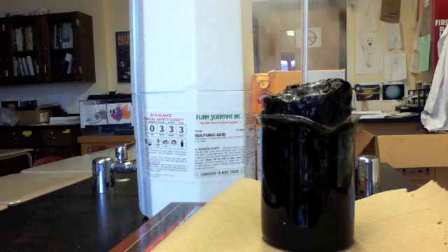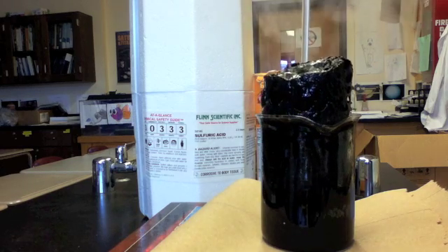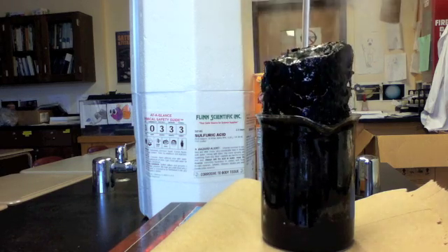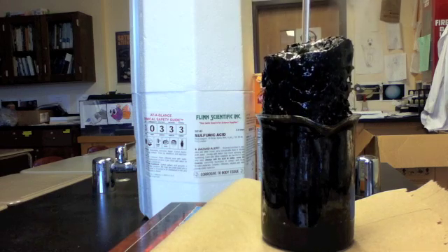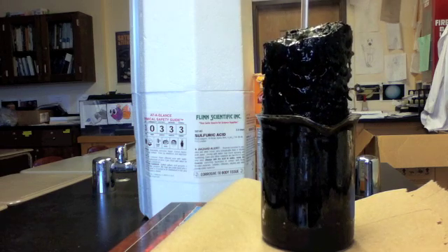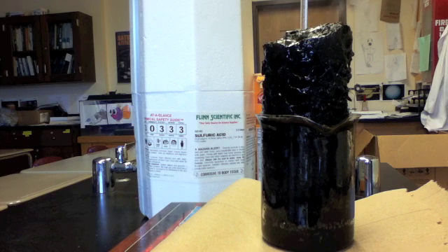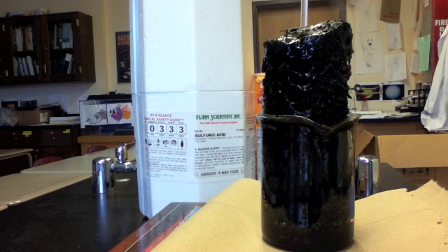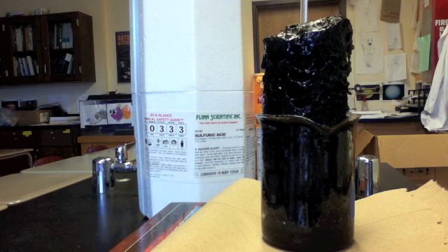Steam bubbles form which inflate the structure into a great height. The smell of burnt sugar is very strong. And there you have the dehydration of sugar by sulfuric acid.